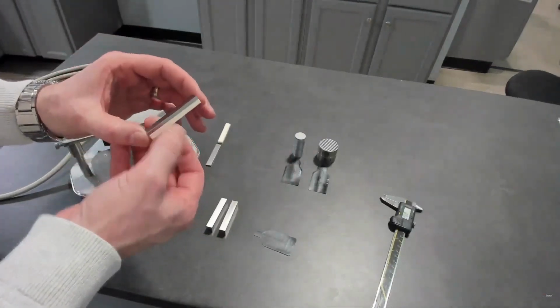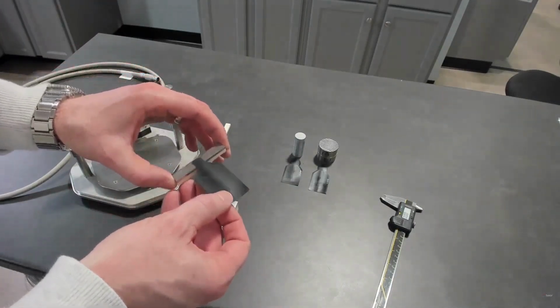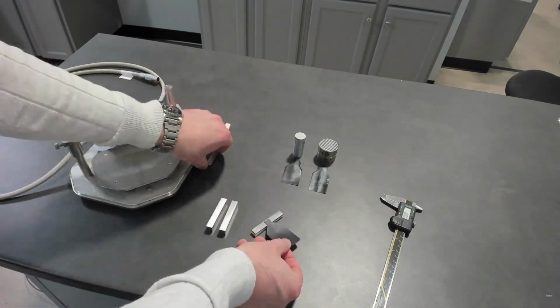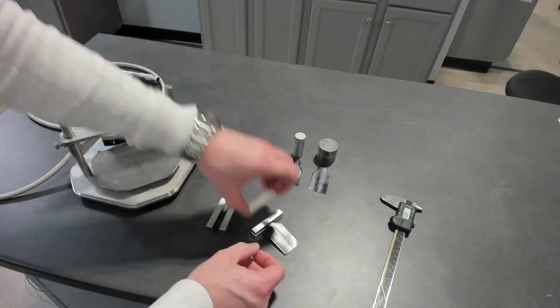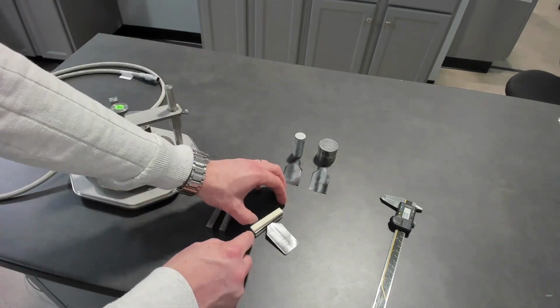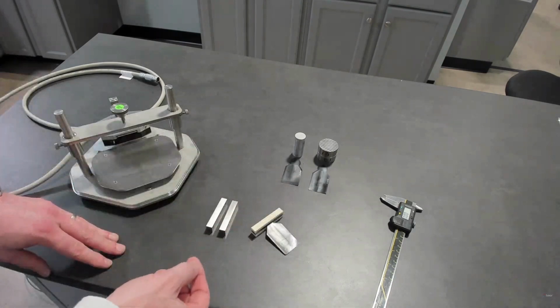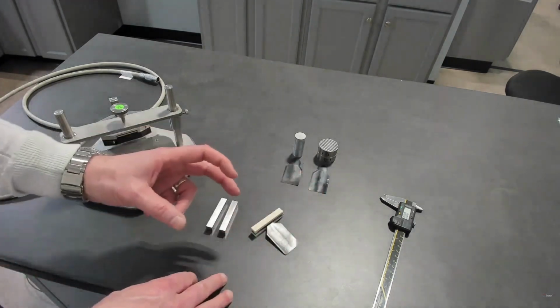This is transient hot strip slab, and then a mirror of the bottom on top. So our configuration would be like that, and we would put this in the sample holder. We run that, and that would give us slab, with a thermal conductivity, thermal diffusivity, and specific heat along that direction for a thin material.